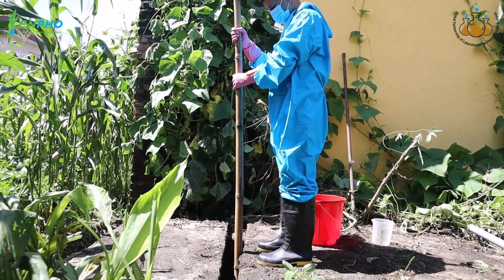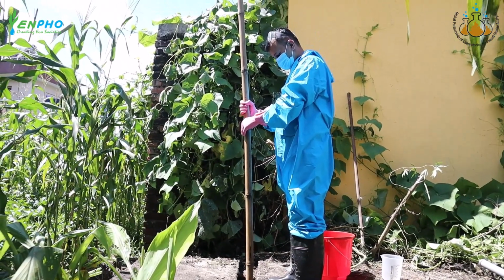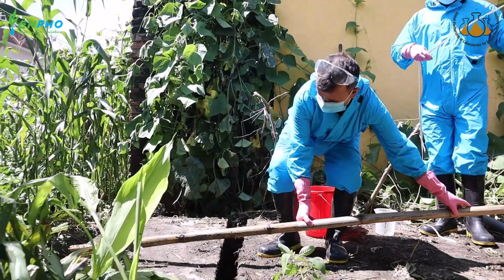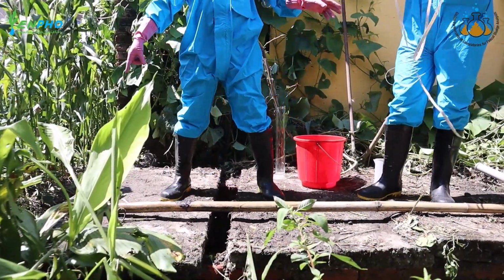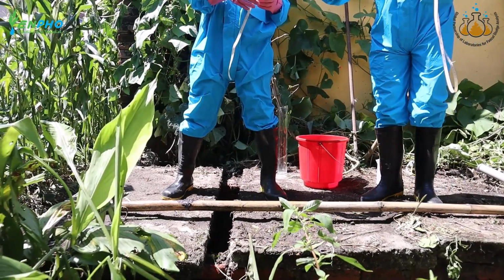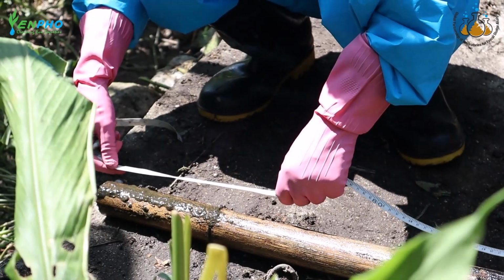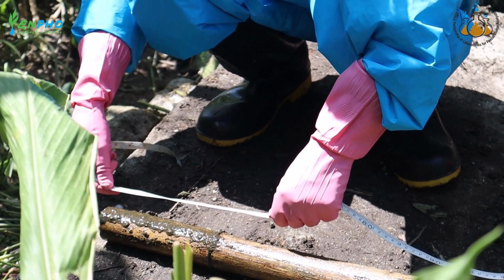To determine its depth, the researcher carefully lowers a long stick into the containment and then withdraws it. The sludge leaves a clear mark on the stick, which is then measured with a measuring tape. The distance from the base of the stick to the mark is measured to be 0.2 meter, which is the depth of the sludge. A sample is collected from this depth to ensure it is truly representative.